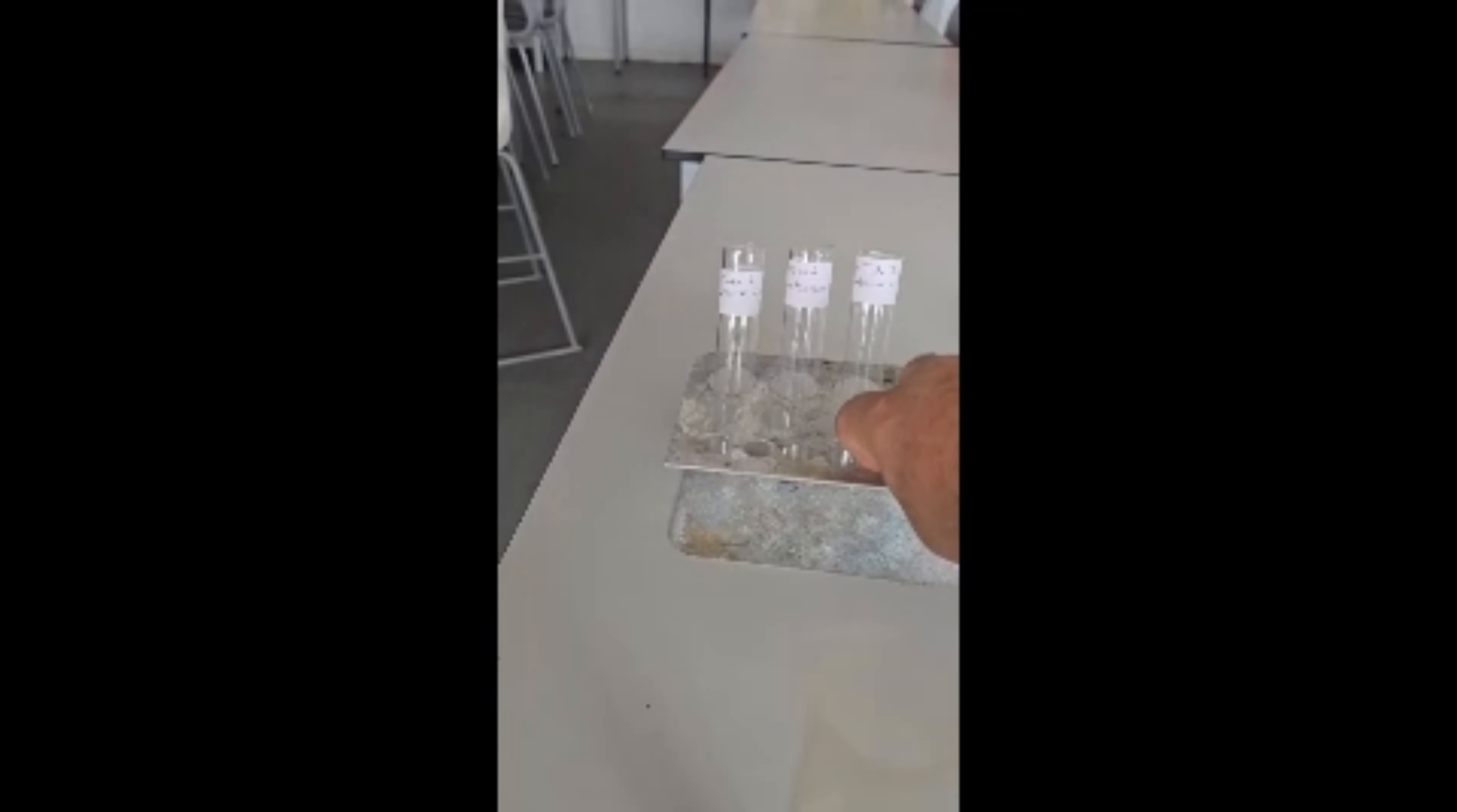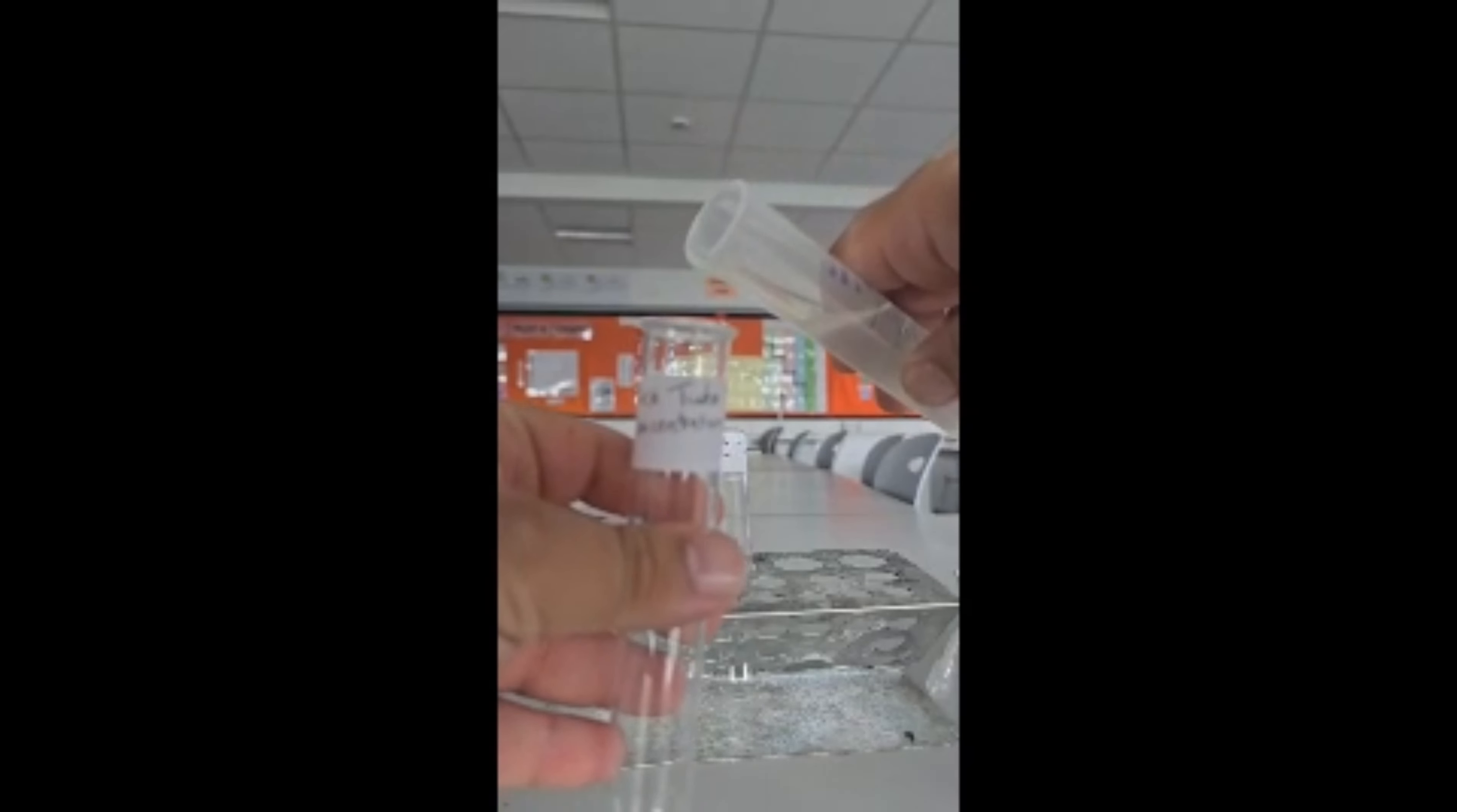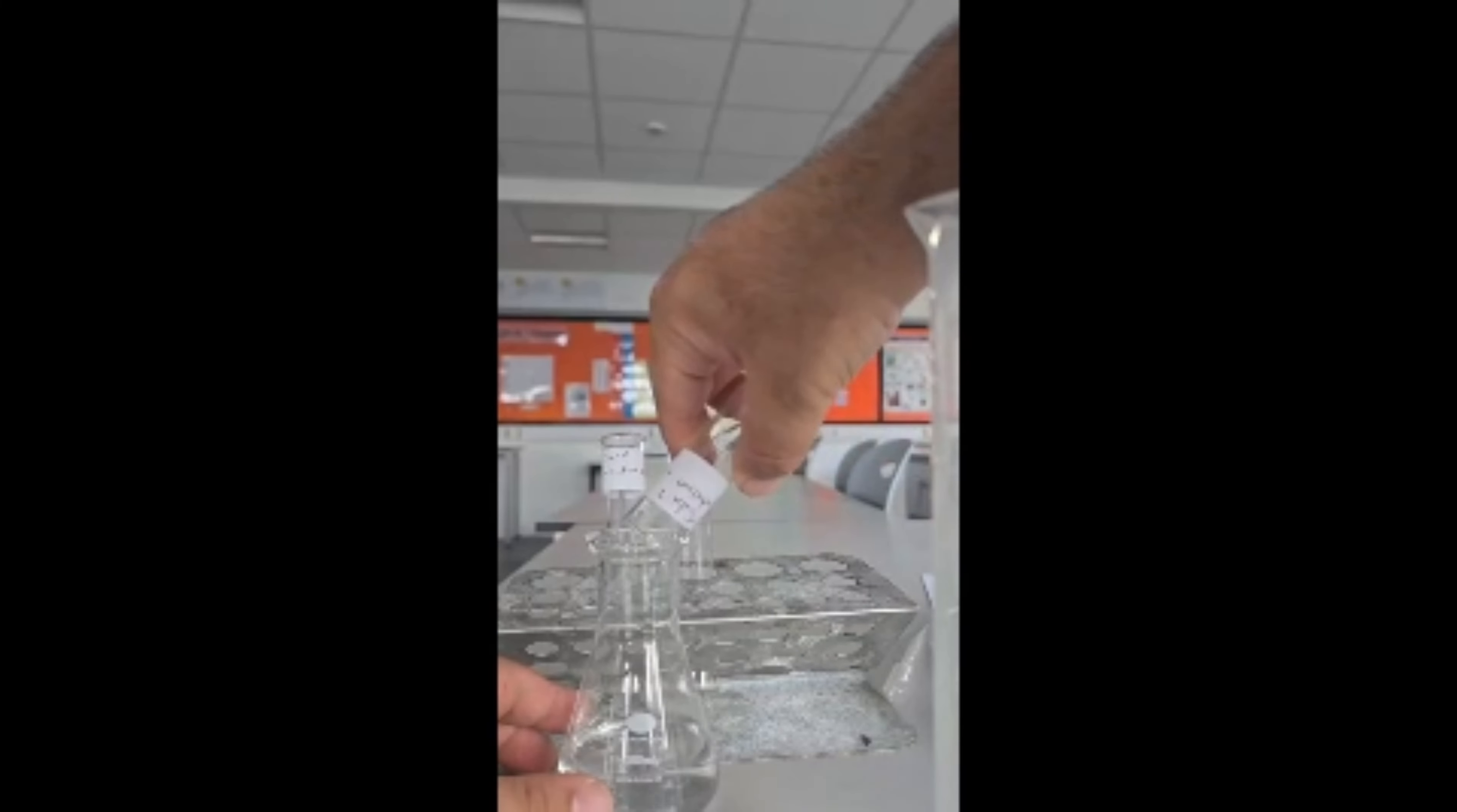Transfer this to the first boiling tube. You'll do the same for the other two boiling tubes using the recipe. I'm not showing that in this video.